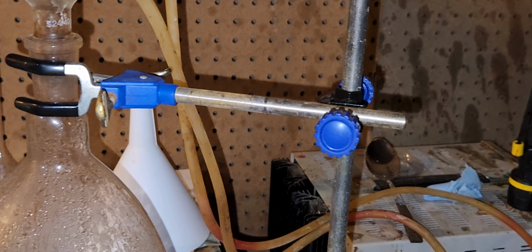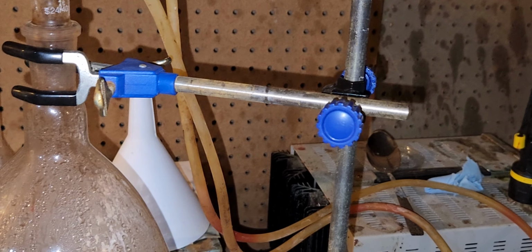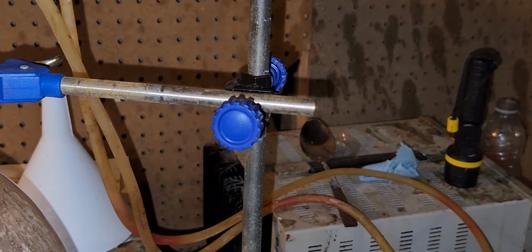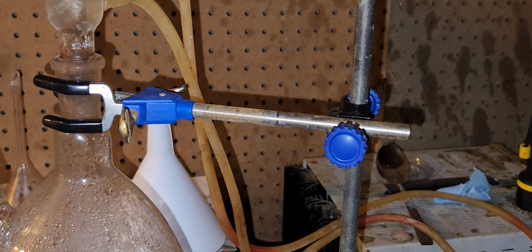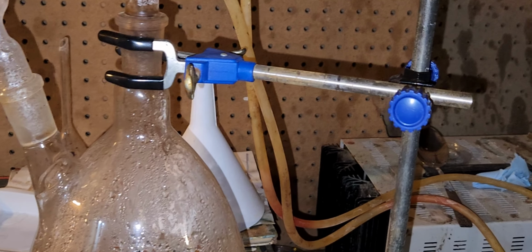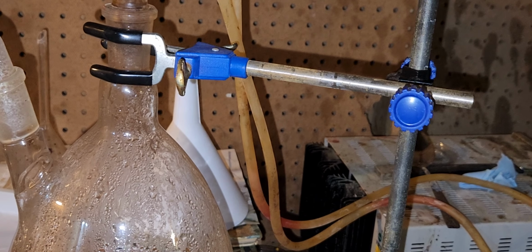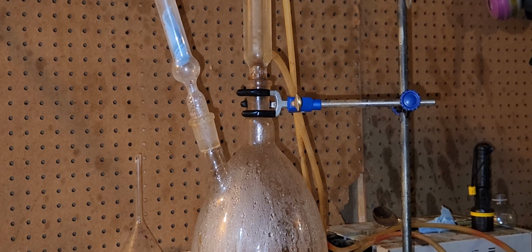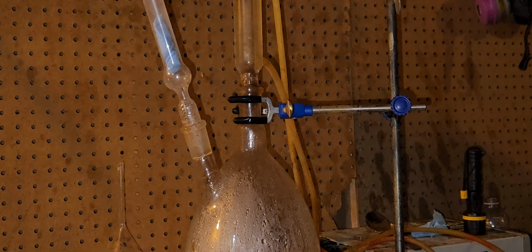I learned my mistakes. If you're gonna do it, put in the vanadium very slowly as you heat it up. But be very careful because vanadium is very toxic. Wear a mask and put it in with a funnel or something like that, and slowly put in and stir it around. You have to have a better method than this. Maybe you should have a funnel like this to put in vanadium, so the vanadium can be pumped in separate to the lye.